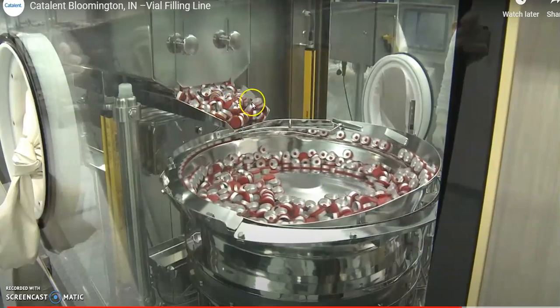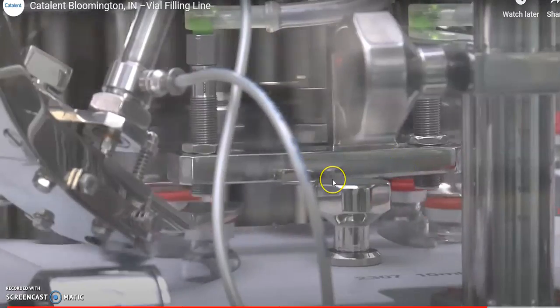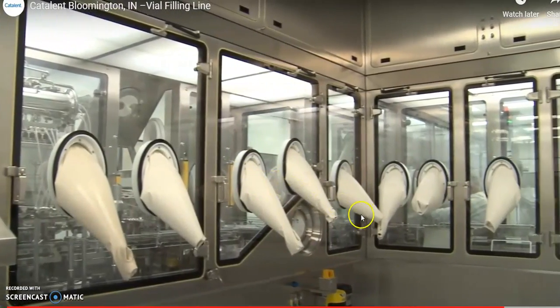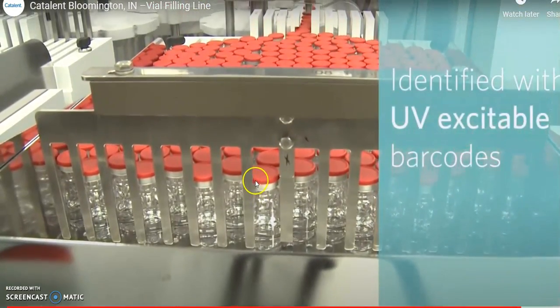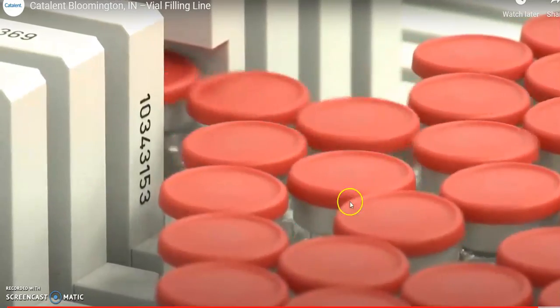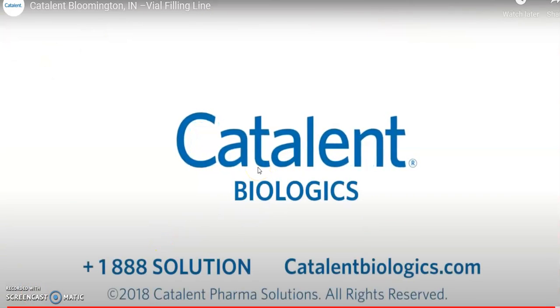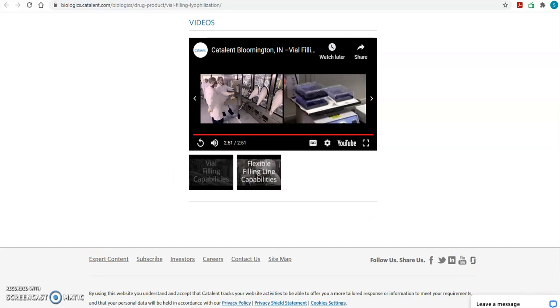And these are the seals, or crimps. After putting the stoppers on, you see the aluminum seals are placed on top of them. The capping or sealing is done automatically as well, pressed in automatically, and then labels are placed after that. So that's the automatic process at Catalent. Okay, so let's see. I'm going to go back to the PowerPoint slides.